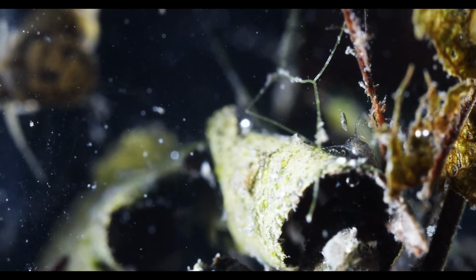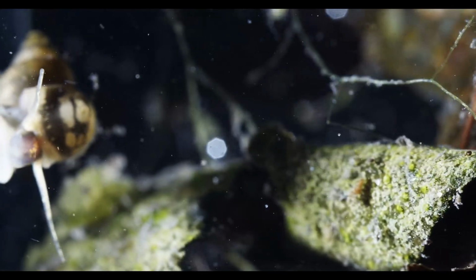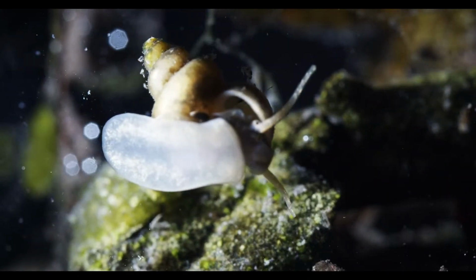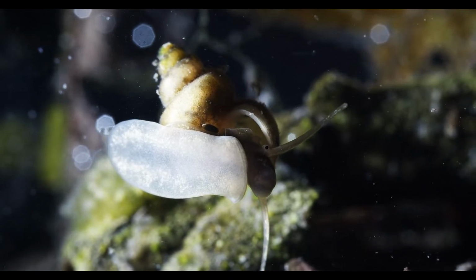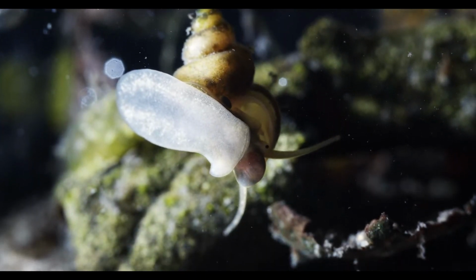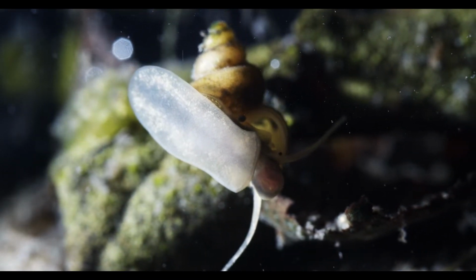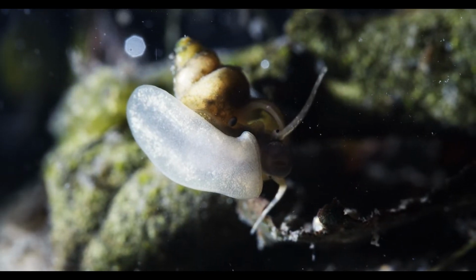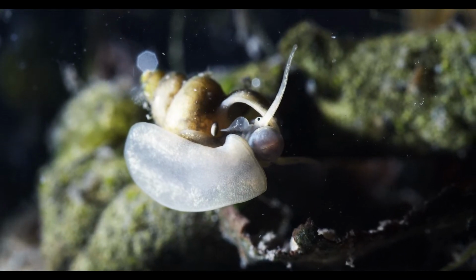Oh, the snail is on the side of the glass, so you can check out its mouth. No, it's in the shade, but you can kind of see the cilia. If I keep it right here in the middle, you can see the cilia on the front of the sole beating. I hope that shows in the stream. I've noticed that some of the detail isn't reaching the other end, unfortunately.